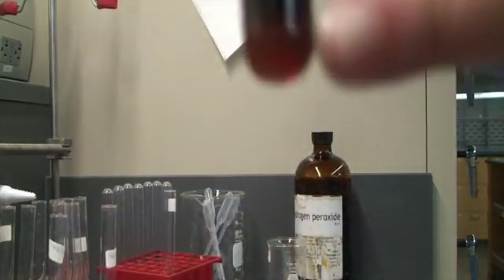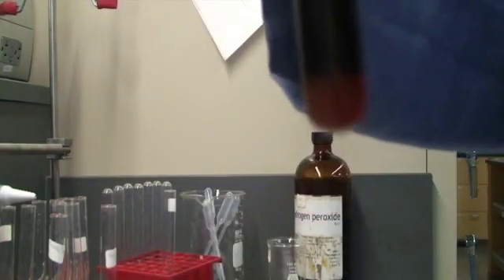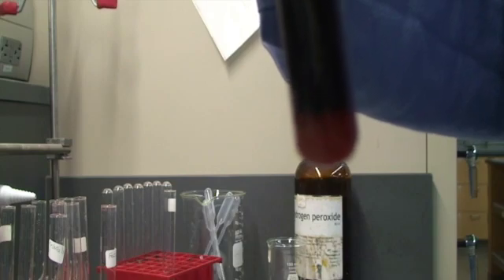Don't see any change. Let's add 5 more. I don't see any change — it looks like it's getting a little lighter at the bottom. Let's add some more. So now we're at 15 drops. It's definitely getting a little lighter at the bottom.